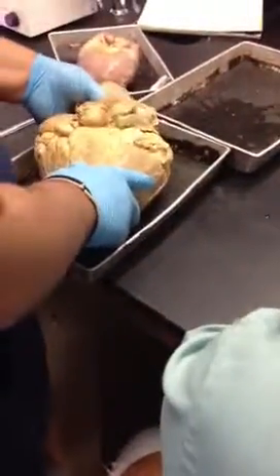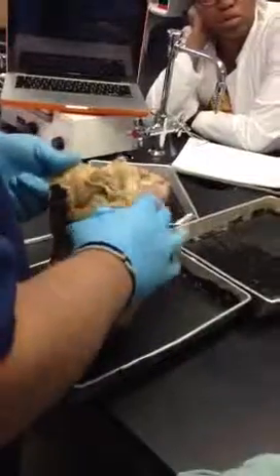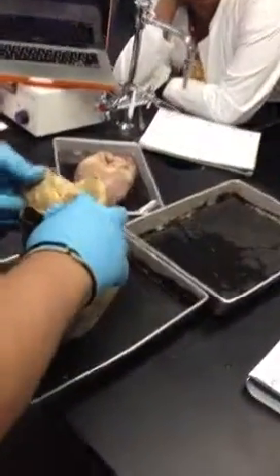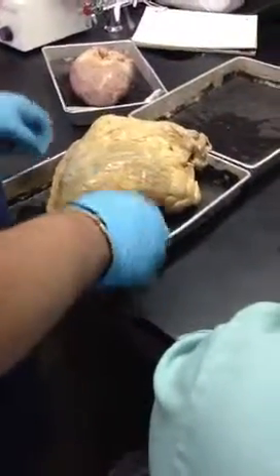Okay. Now, if we look at the aorta here, you'll see that the aorta comes out, but there's a blood vessel right here that comes out of the aorta. This is the brachiocephalic artery right there, so that's what that is, okay? Y'all good so far? Okay, the tip of the heart, of course, is the apex. I don't think that I have to explain that. All right, y'all look good on that?